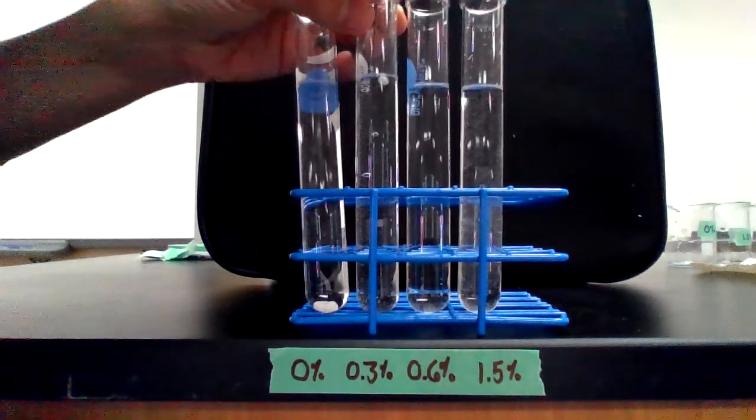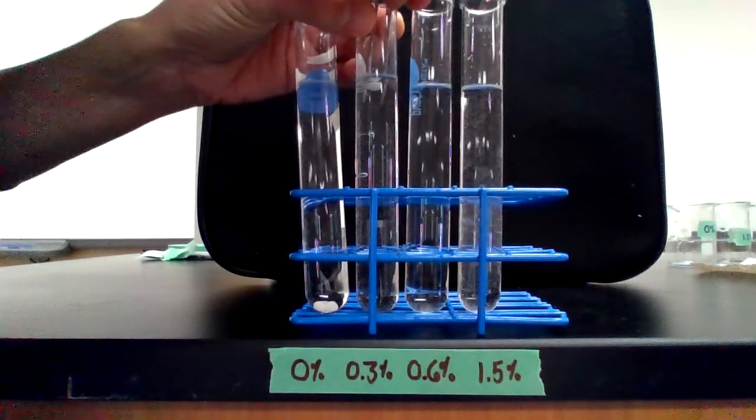All right, I will remove that bead so you don't get confused about which one you're watching.